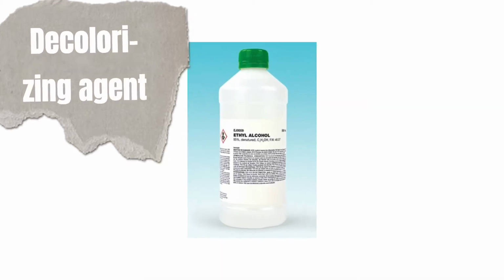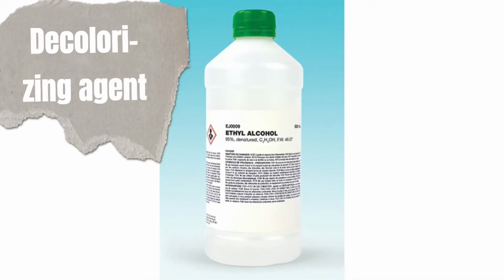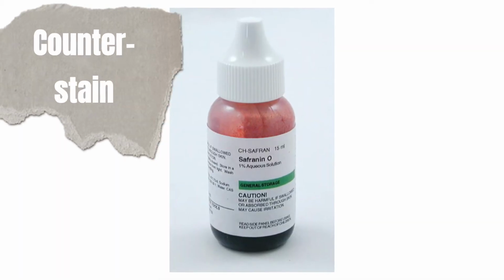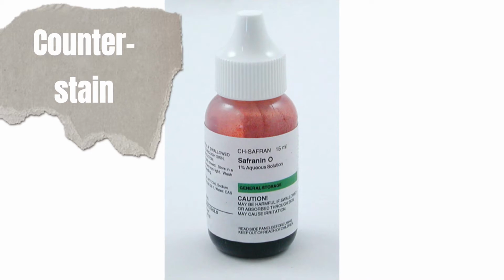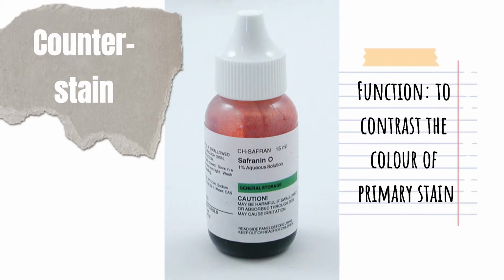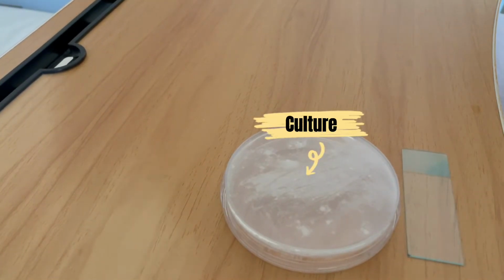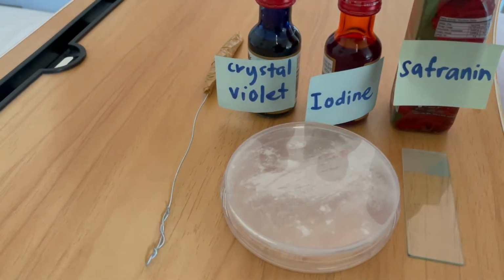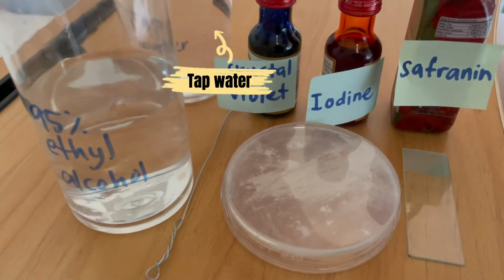The 95% ethyl alcohol is used as the decolorizing agent to establish a color contrast. The last reagent is the counter stain, for which we will use safranin. Its function is to contrast the color of the primary stain. In this experiment, you will need a culture, a slide, an inoculating loop, the reagents, the alcohol, and tap water.